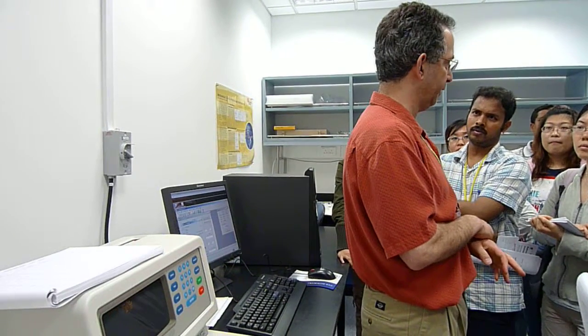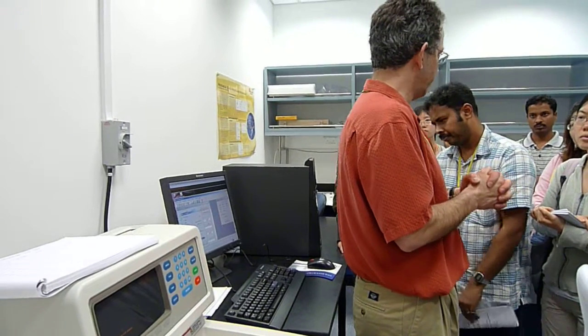There's a bunch of errors that can come up with this, and I'll be very honest, maybe you guys are going to have them with our instrument. The data acquisition board tends to throw errors every once in a while, irreproducibly. And it's a real shame when it happens in an important experiment at 10 at night when no one's here. For that reason, I think it's extremely important to not walk away, at least until you're beginning to collect data and you like what you're seeing.